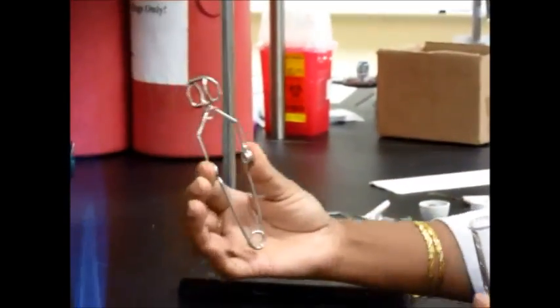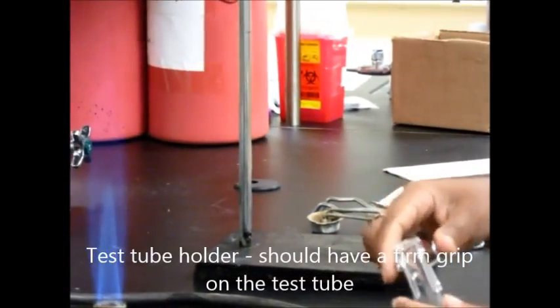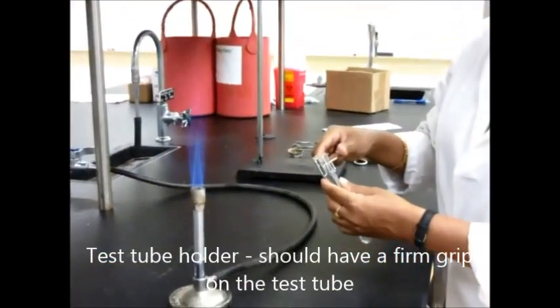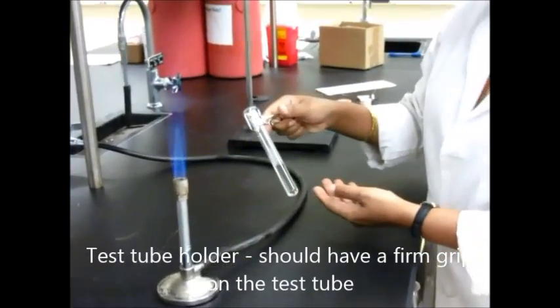This is the test tube holder that you're going to use for this. Hold the test tube like this. Make sure that it is nice and snug and doesn't slip out of your hand.